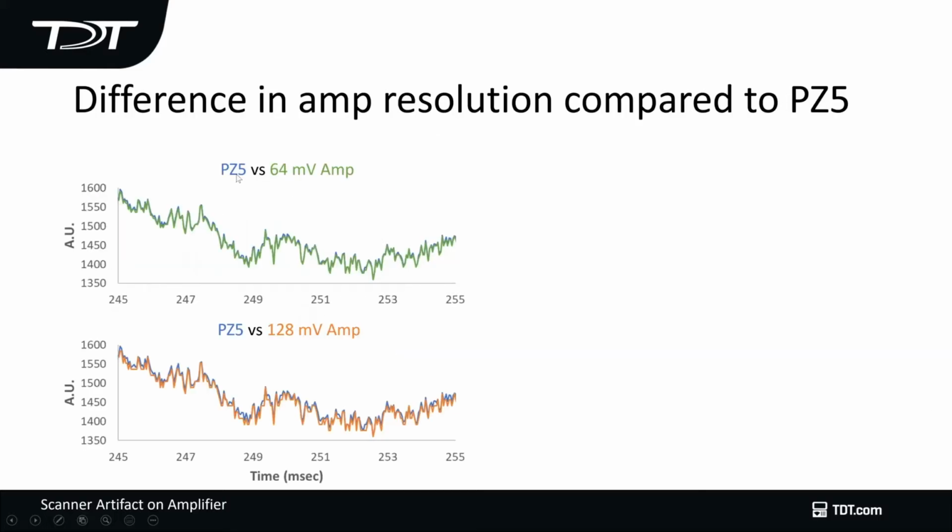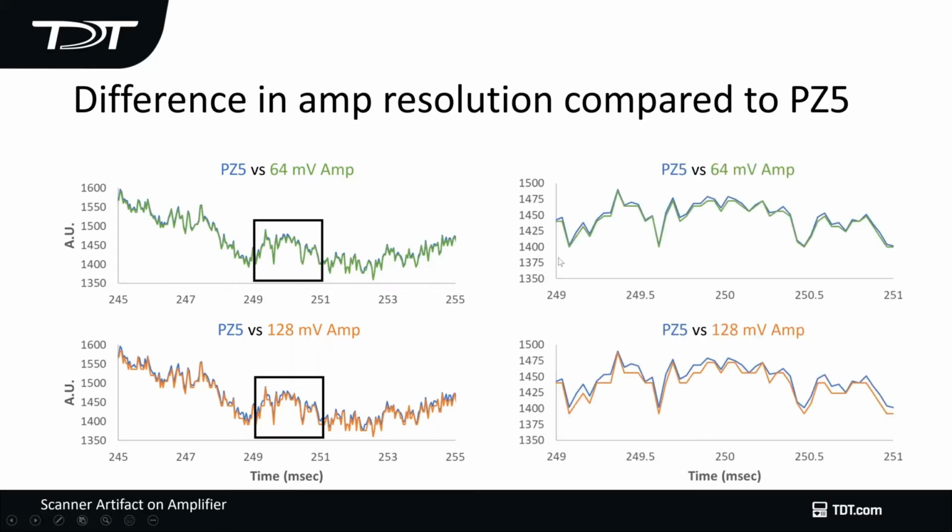So for example, here's a PZ5 versus a 64 millivolt amp. If you look over a 10 millisecond range, there isn't much difference. Same here. You can see small variations when you compare it to 128 millivolt range. But when you get to looking at the 1 millisecond time scale, you start to see that the signal is really distorted and smoothed out compared to that of the PZ5 amplifier. So signal resolution and dynamic range become very important as you increase your input range.